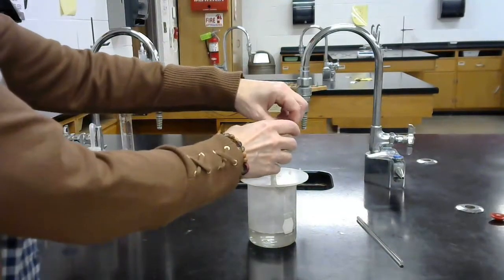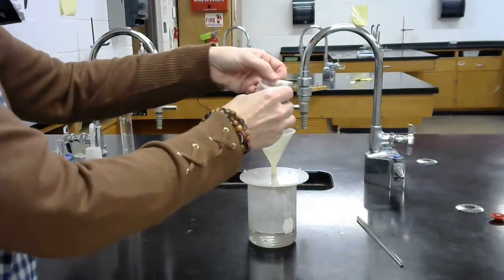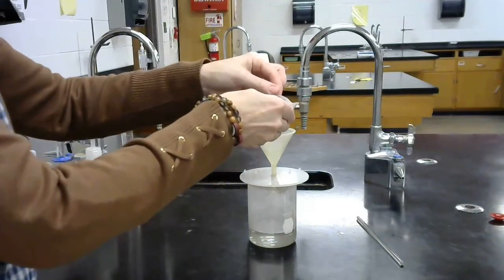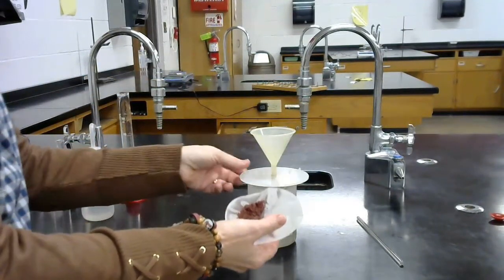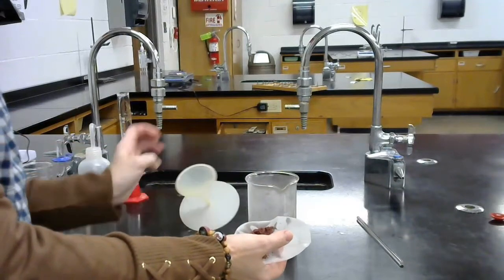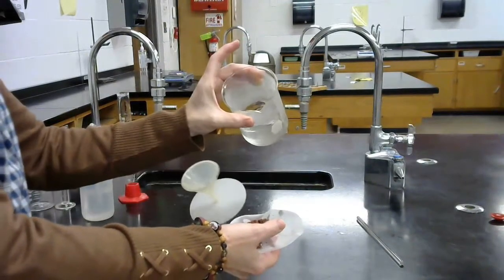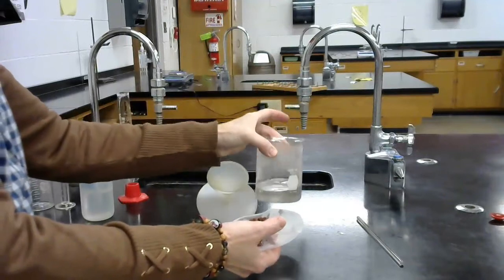Here's our precipitate. We are going to open this up. There it is in the filter paper. Now the filtrate, which is left right here, whatever is soluble is the substance that's left in there.